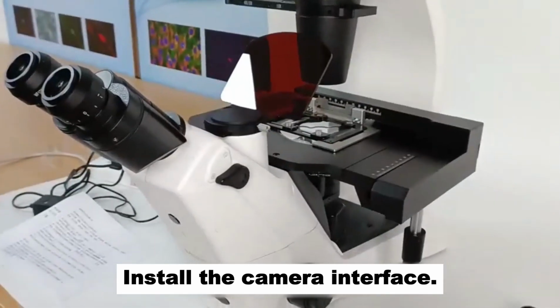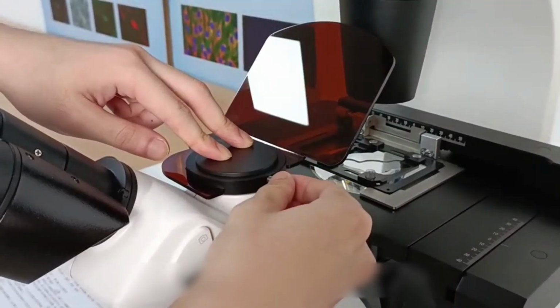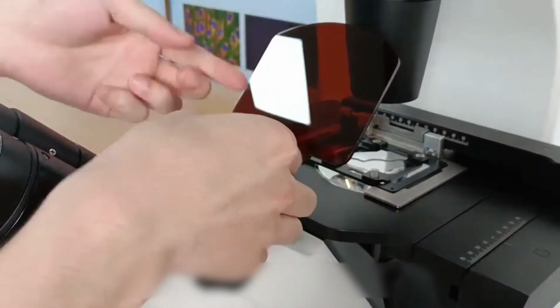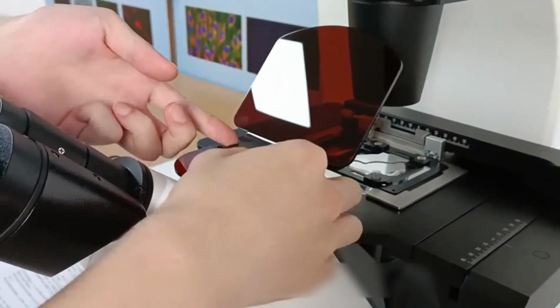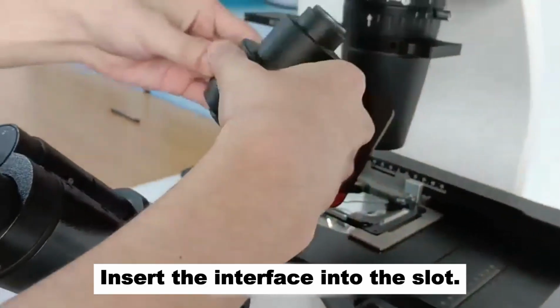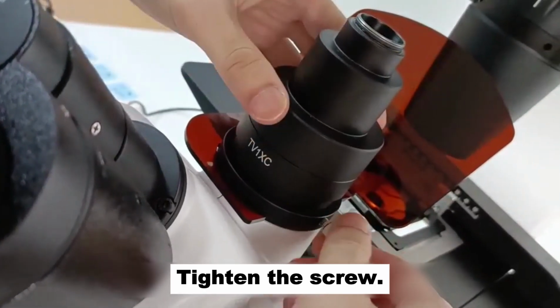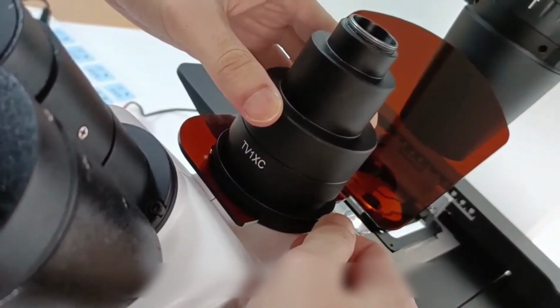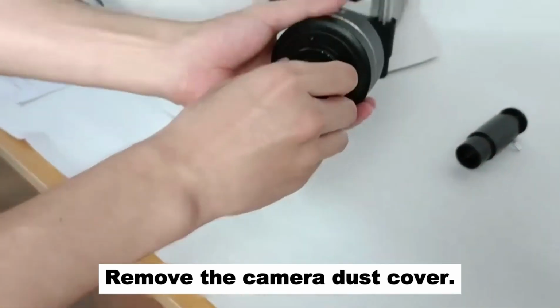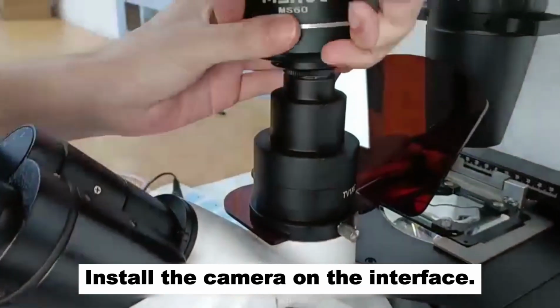Install the camera interface. Loosen the screw. Open the dust cover. Insert the interface into the slot. Tighten the screw. Install the camera. Remove the camera dust cover. Install the camera on the interface.